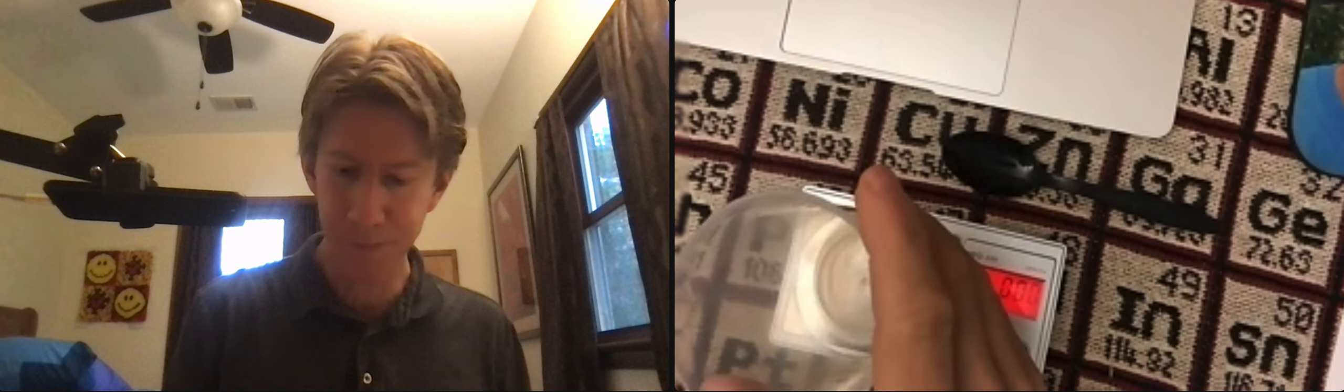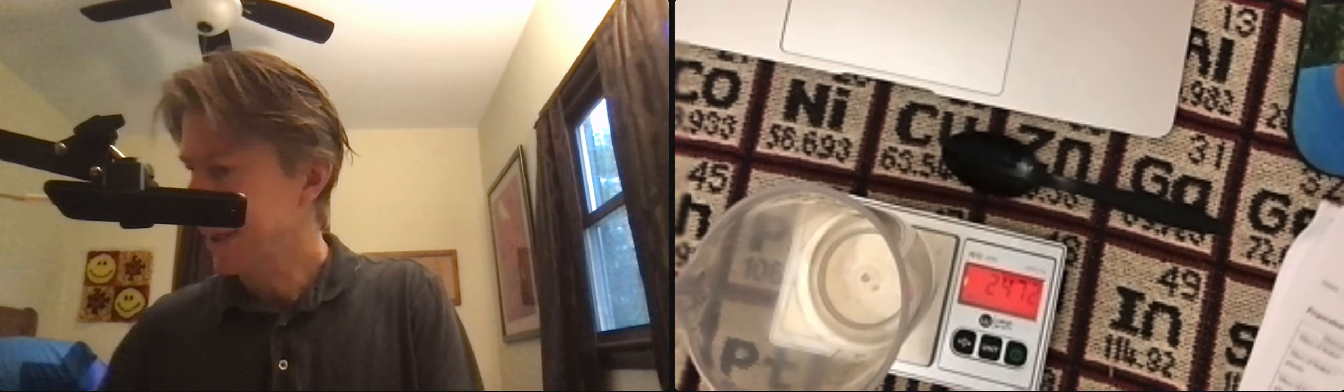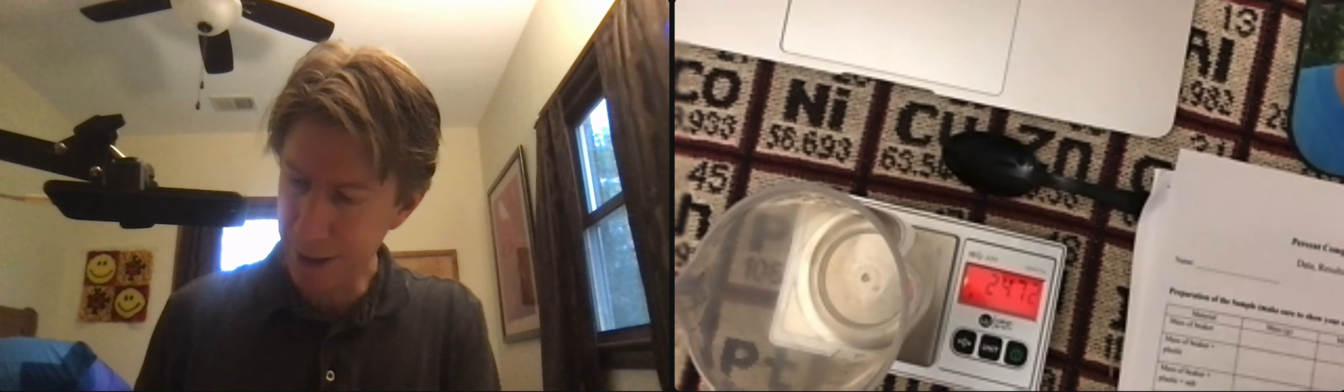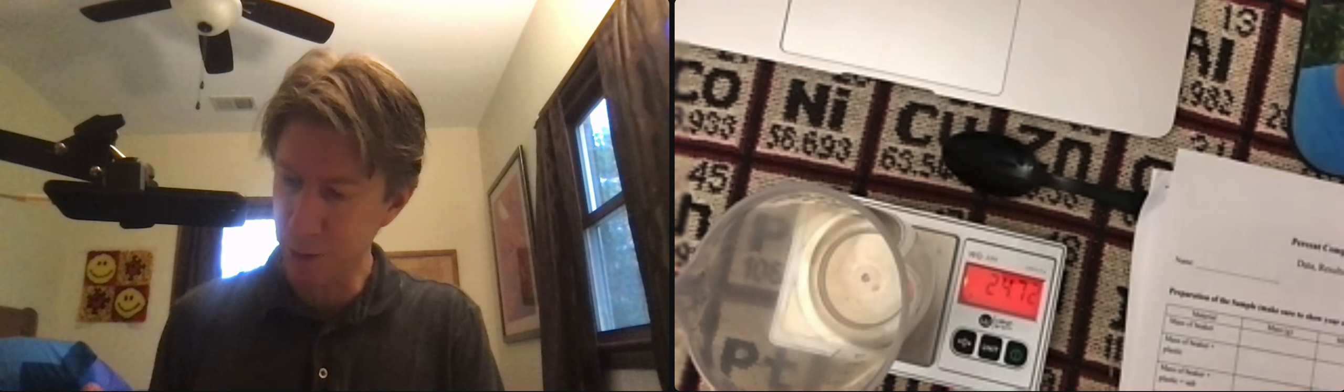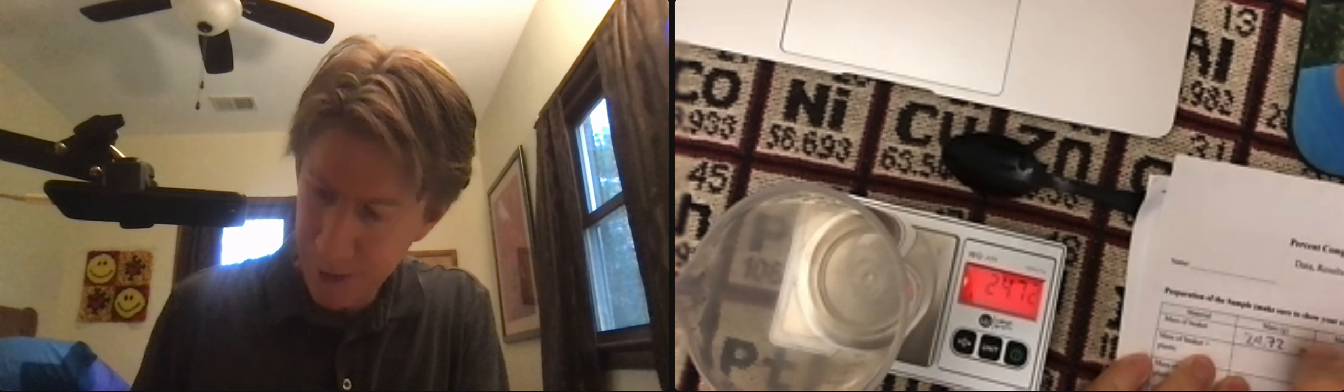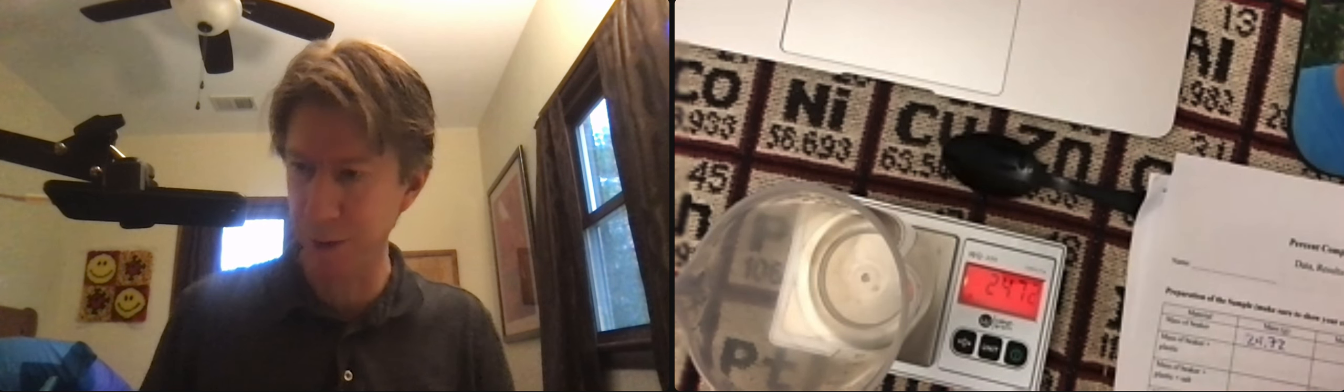And on my page it says this weighs 24.72 grams and it says grams up there so I'm okay.